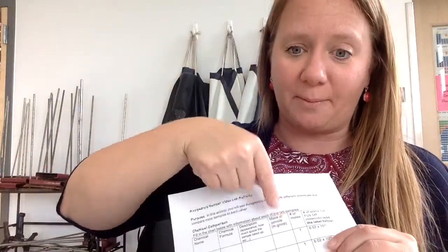All right. For description, you will be using what you can see in the lab. So we'll do that together. For mass of sample, this is the molar mass, so you're using grams per mole. You need to get that from the periodic table. Once you have the correct formula, you'll know what elements you're dealing with. You'll add up those molar masses if it's a compound to get the mass of the sample in grams per mole. And if it's an element, then you don't have to add anything up. Then you just put that number there.